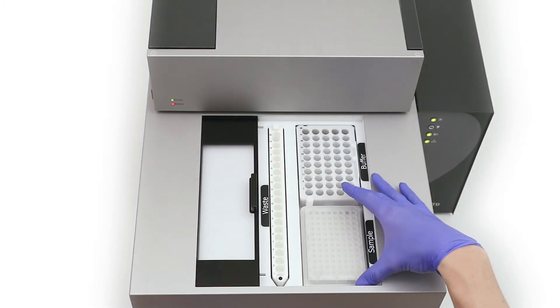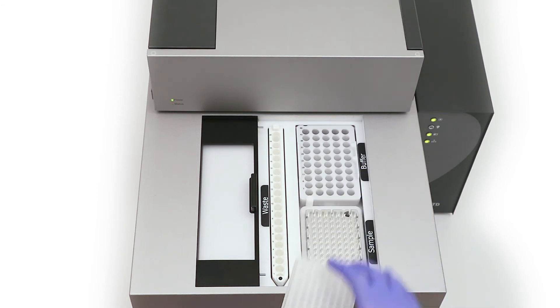Reinstalling a vial tray. Gently remove the microplate from the adapter and put to one side.